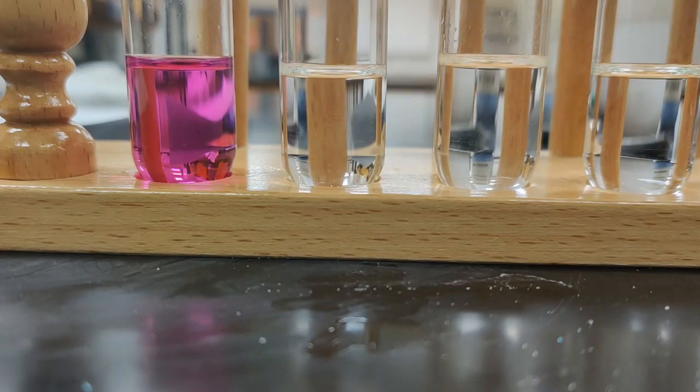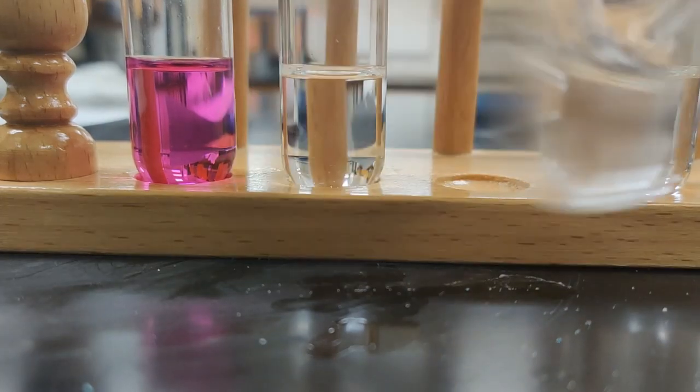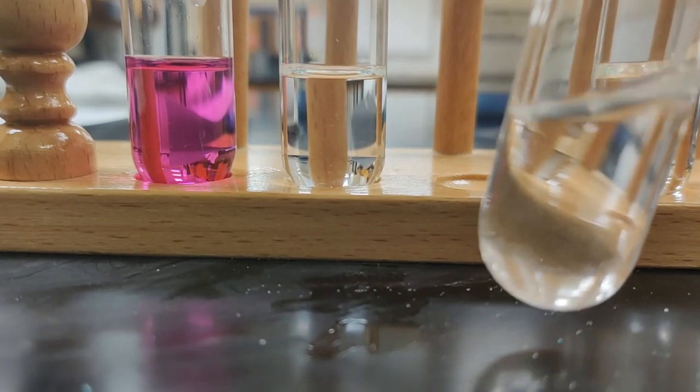So the one thing we haven't been able to dissolve in any of our solvents yet is the naphthalene. So I'm curious to see if maybe this will dissolve in hexane. Maybe stinky things dissolve in stinky things. I saw the solid fall through, but let's agitate and make a decision here. And maybe one more little agitate. Let's see if we still see any solid in the bottom.